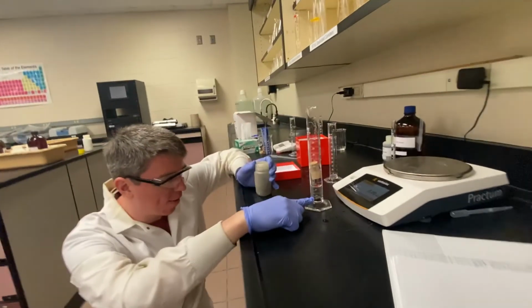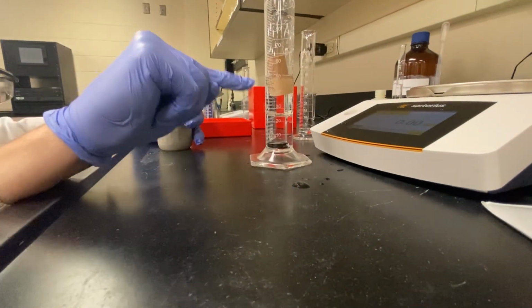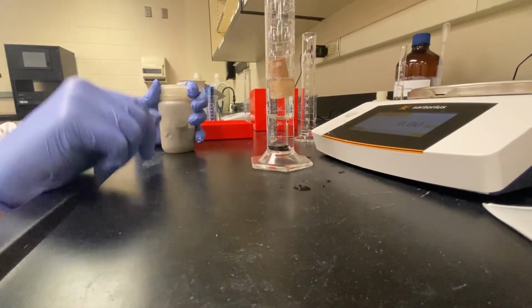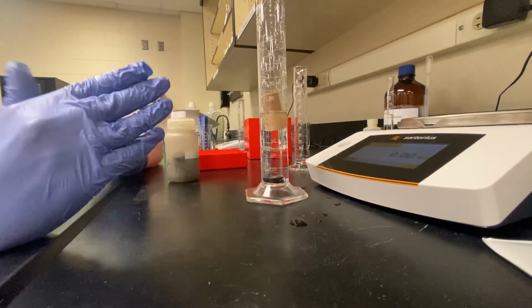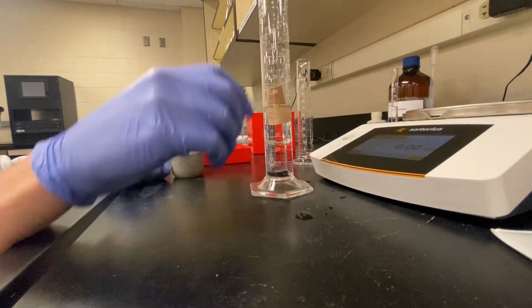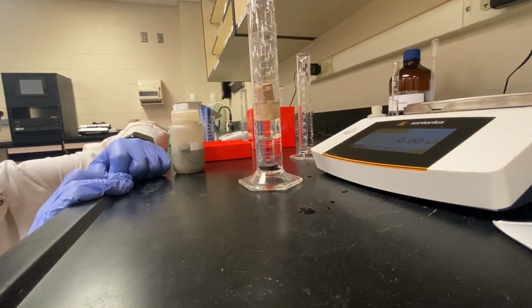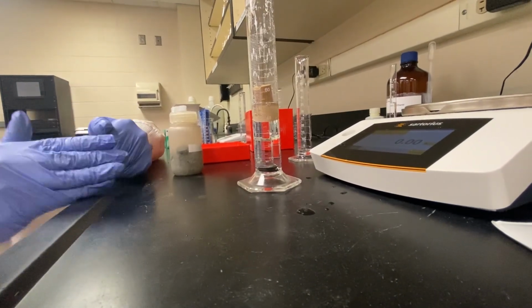So what we can see is we get some very specific layers. We can see the pennies at the bottom. There's some liquid in the middle here. We've got another liquid on top of it, and then we have our cork. And what we can see is when we look at all of our densities, the densities will actually tell us what order these add up in. And so this is a visual way to look at how those numbers compare.